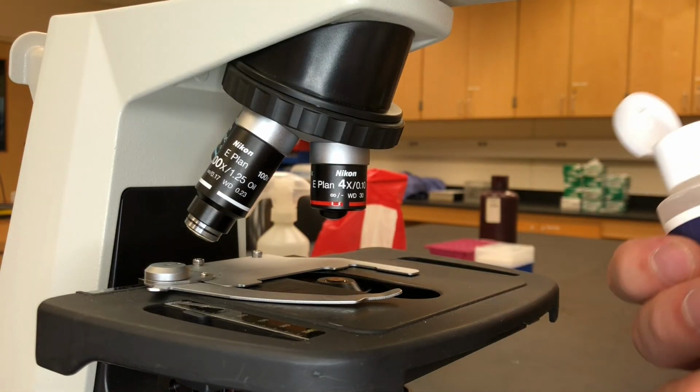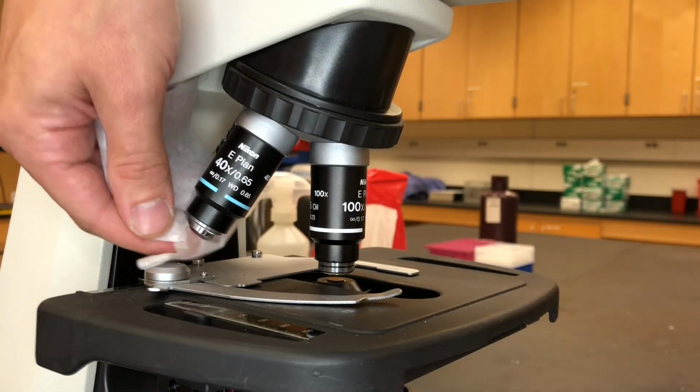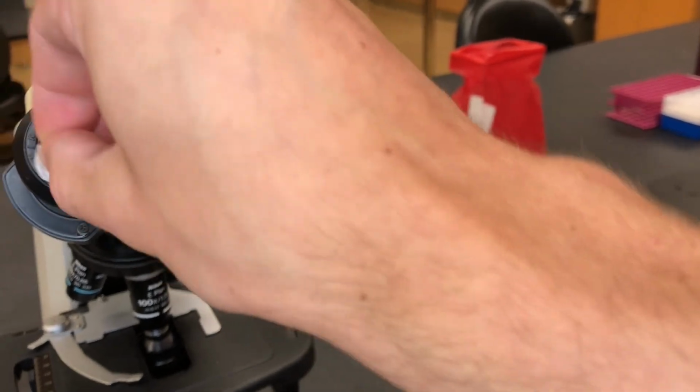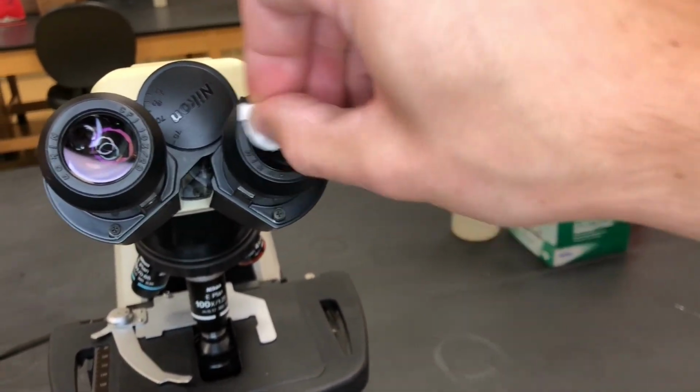If you're having trouble focusing, it might be that you just have a dirty lens. Take some lens paper and some lens cleaner and just wipe underneath the objective lens that's giving you problems. Dry it off with a new piece after that. Then take another new piece of lens paper and ball it up and wipe your oculars down. I used to breathe on that to get it foggy before I did this, but with COVID, I would advise against that.